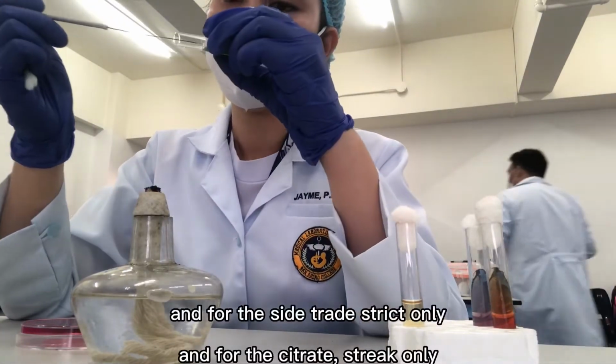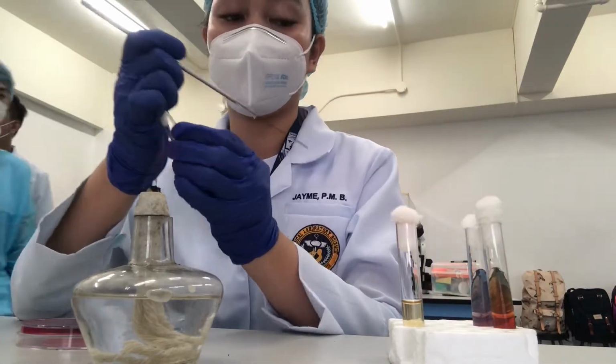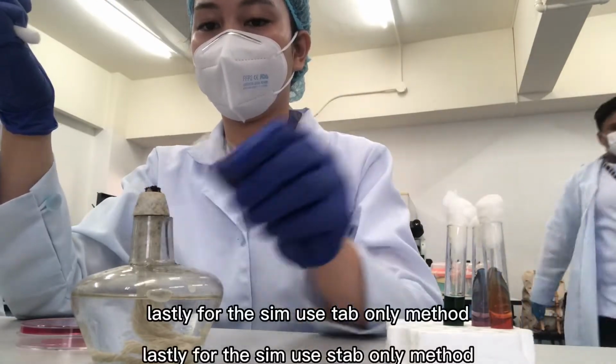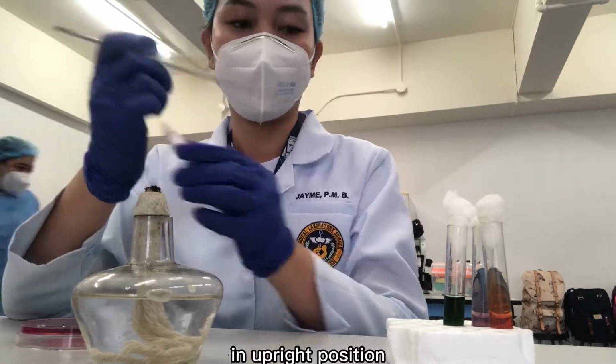And for the citrate, streak only. Lastly, for the SIM, use the stab only method in an upright position.